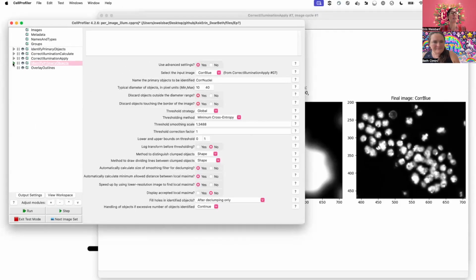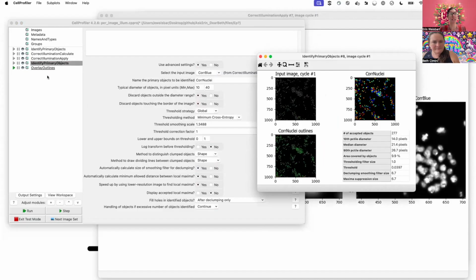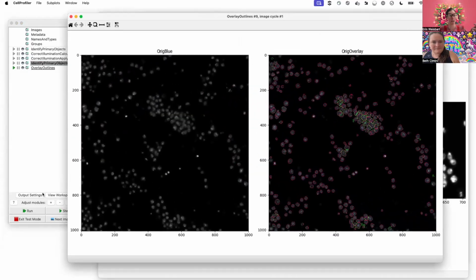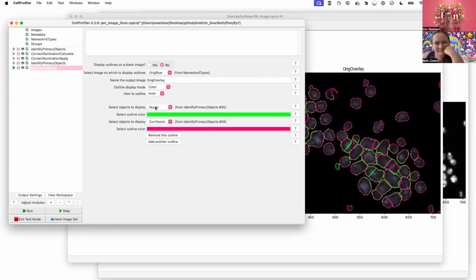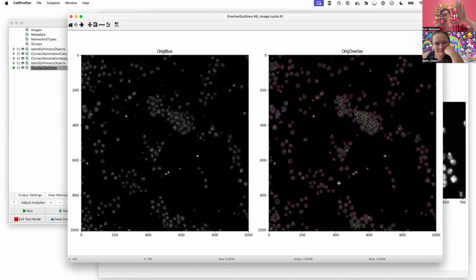But if I then identify primary objects in my corrected nuclei, here I have this Overlay Outlines module. I could also show you this in the workspace. I could open up the workspace viewer and look at different objects in the workspace viewer. It's a tricky, fun thing to do, but I had this module handy. So you can see here what I've done is I have put in overlay outlines the original nuclei in green and the nuclei coming from the corrected images in pink on top of that. So I can see here most of the nuclei, right? Most of it, the pink is overlaid on top of the green.